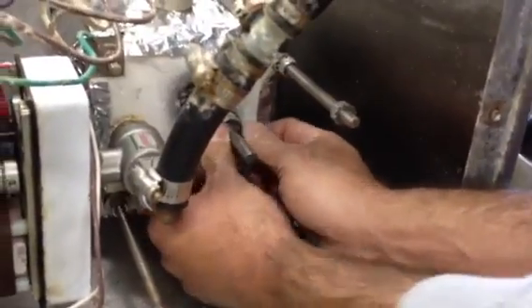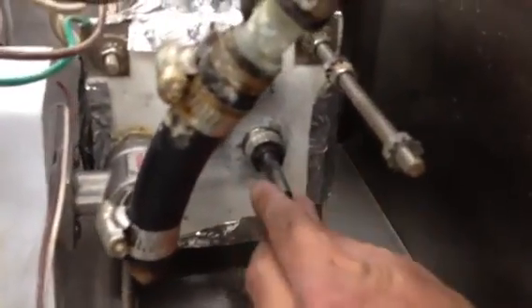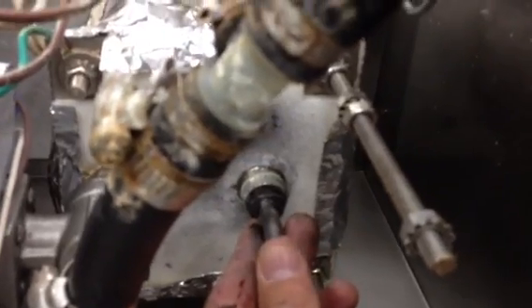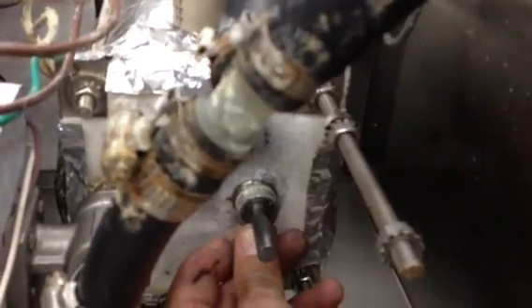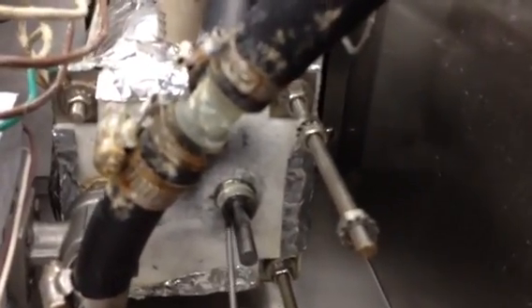And sometimes now, once you start that inside, I'll have Tom slide the agitator up just a little bit, and you'll see that it will slide right up inside. Go ahead, Tom. Suck it up a little bit. Okay. And then you can slide the agitator back down, and that cylinder will stay right inside. Then at that point, you can use the screwdriver to finish getting it up inside the rest of the way.